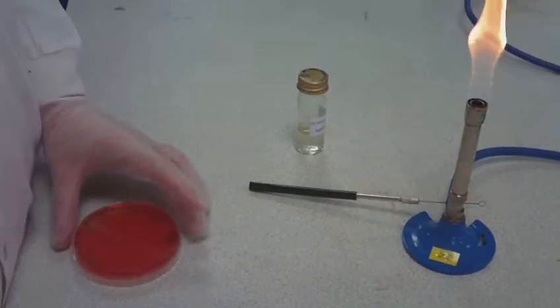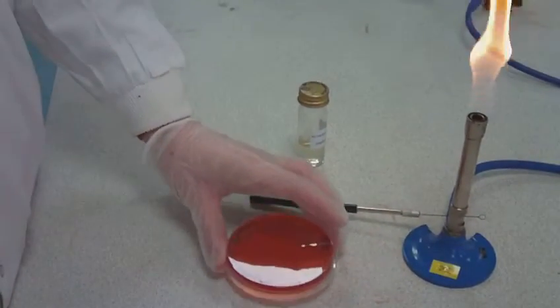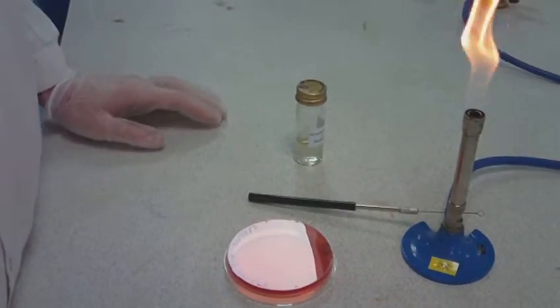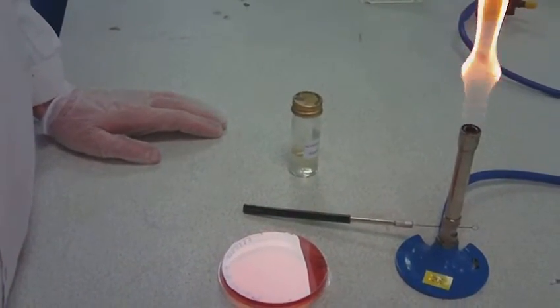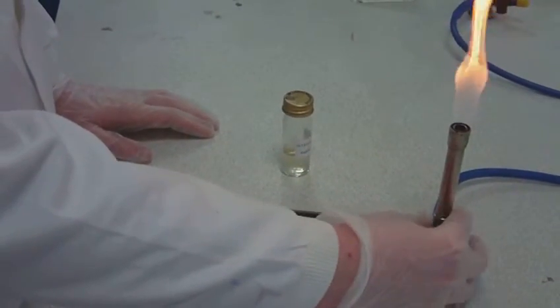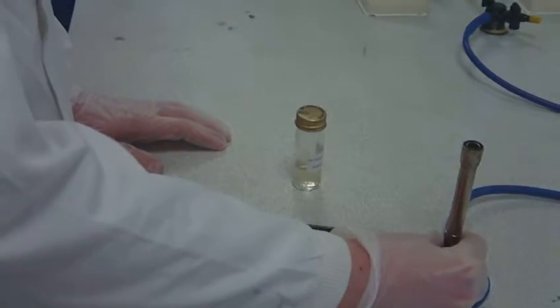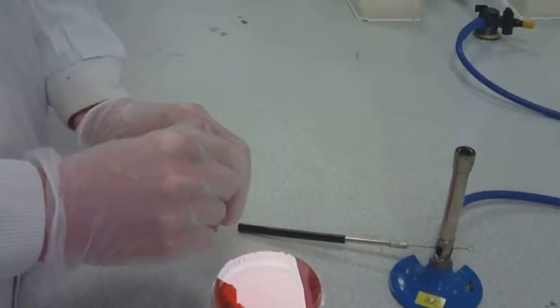Place the inverted plate close to the Bunsen burner to reduce chances of contamination. Turn the Bunsen burner to blue. Loosen the cap of the bottle containing the inoculum.